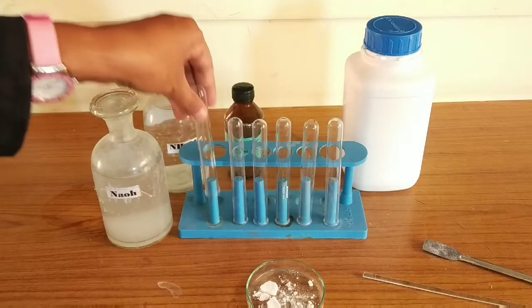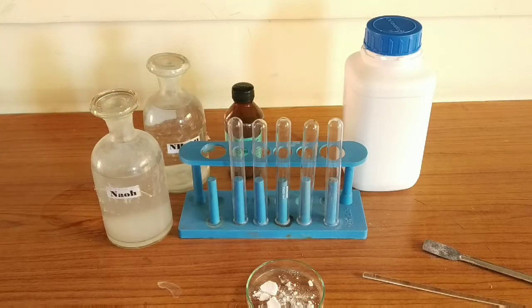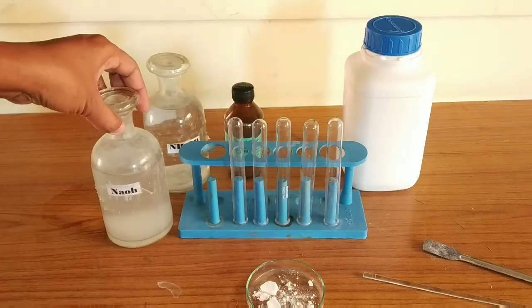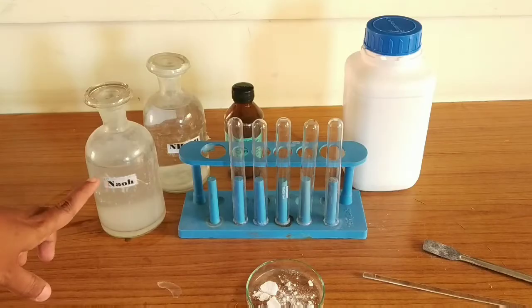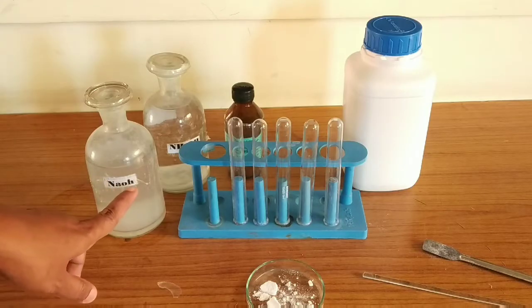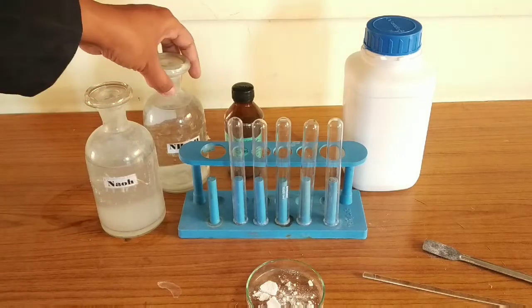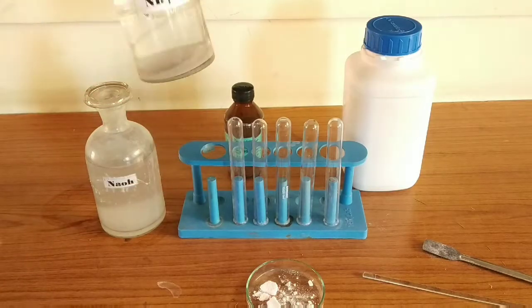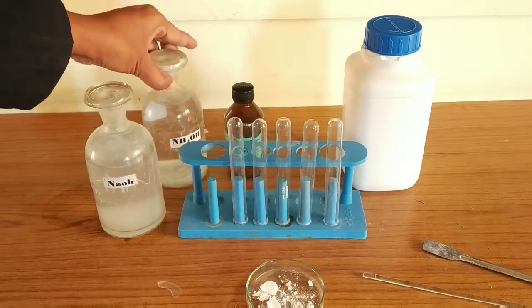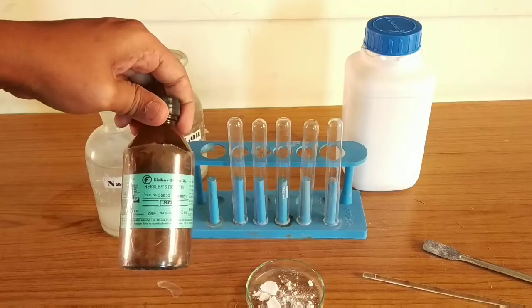Today we are going to perform the test of ammonium ions. For that, we have a test tube and a few reagents: NaOH (by mistake written with a small 'h', but it should be capital NaOH), NH4OH, and Nessler's reagent.